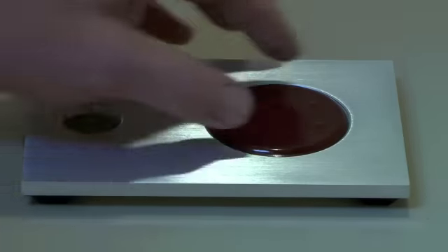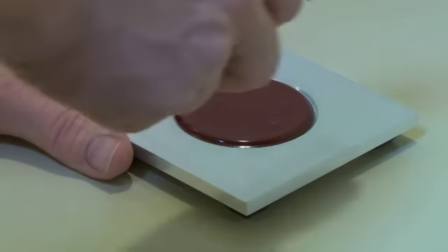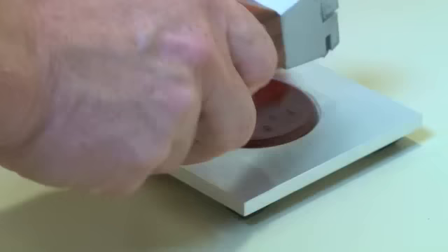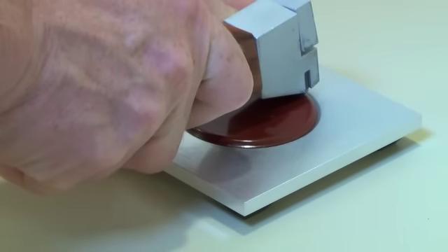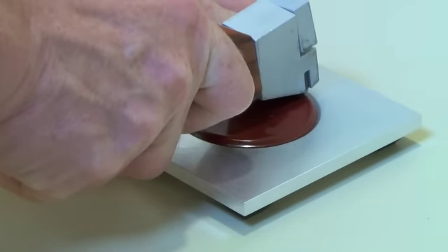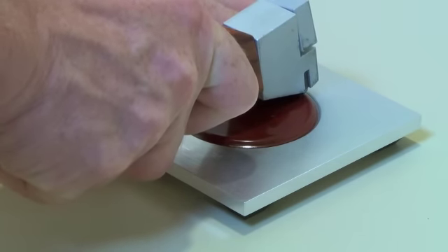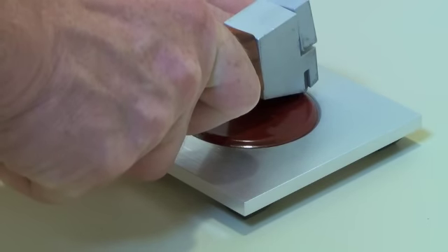So here is our sample mounted into our block. I am going to turn this slightly so we get a good view. I am going to place the cutter on the surface, and in a smooth pull, not a jerking motion, I am going to press down on the handle and cut through to the substrate.